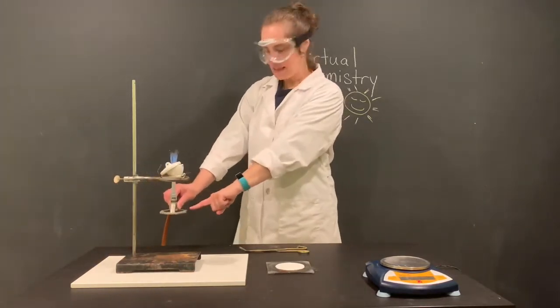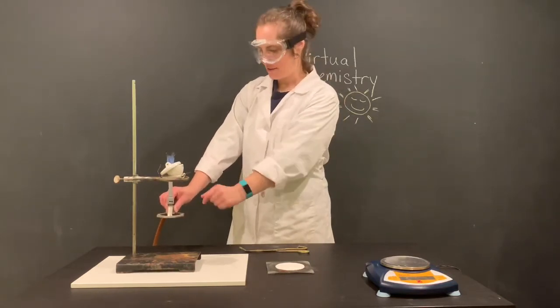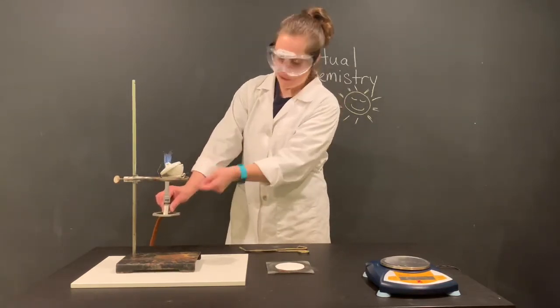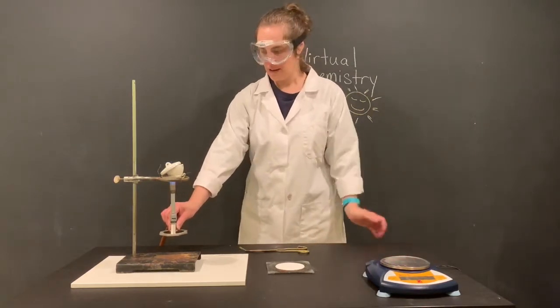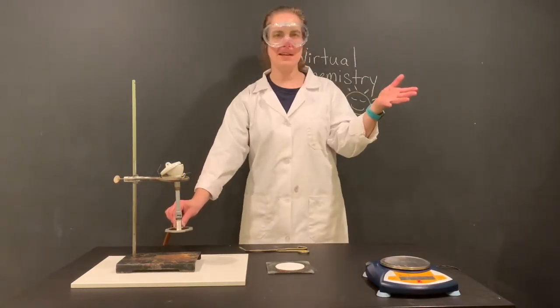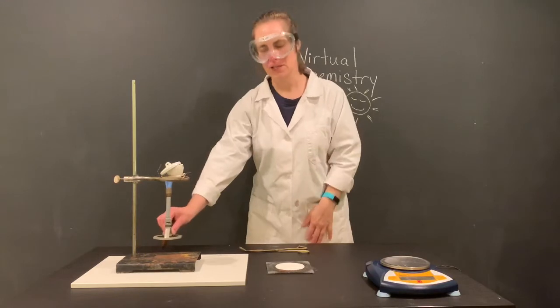You notice I'm going to be holding it by the base, and that's because the base doesn't get hot. The flames are up here, so as long as I touch it on the bottom, it's perfectly safe to move. I don't want to go waving it around as my friends, but I can move it from one spot to another safely.